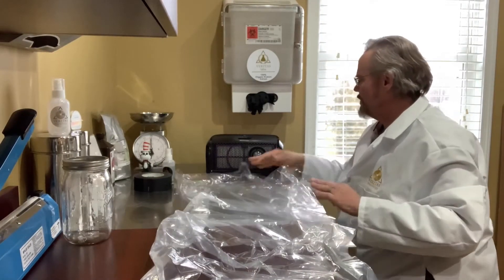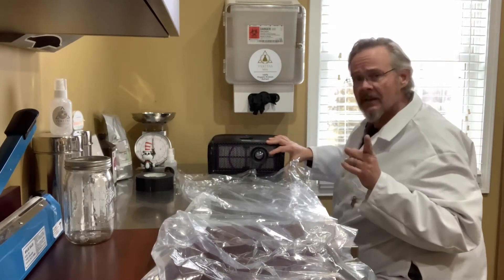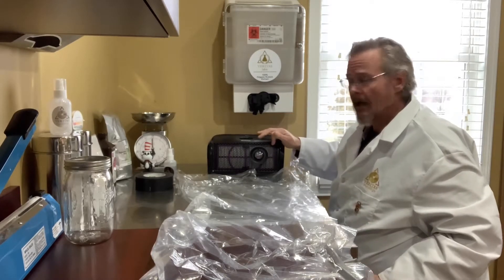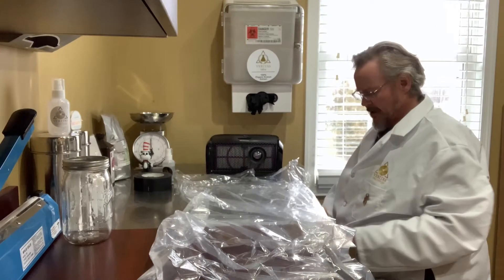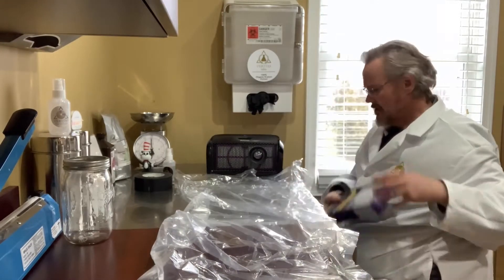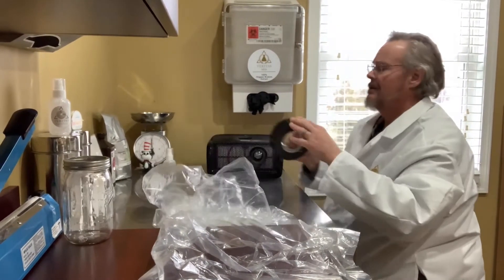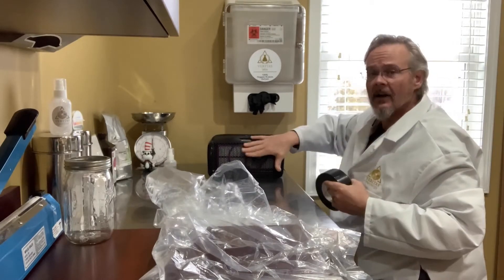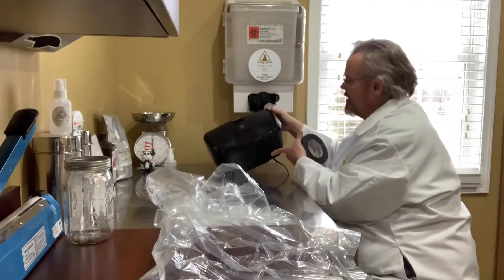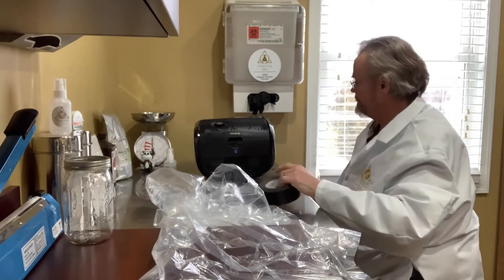Let me show you guys how to do this. Once you've got your filter installed, make sure that you've got a HEPA filter. If your unit doesn't come with one, make sure you buy one. You'll want the purple one — it's 3M Filtrete, the same stuff we run in our flow hood here. Your air intake is here and your air exhaust is here. Turn your unit around like this, ensuring that it is unplugged.